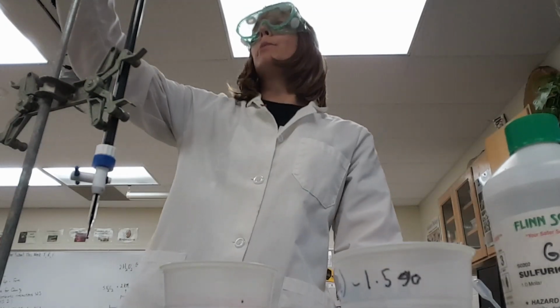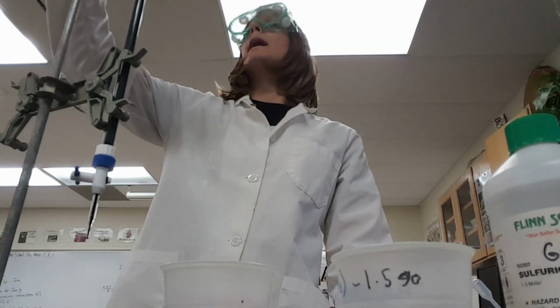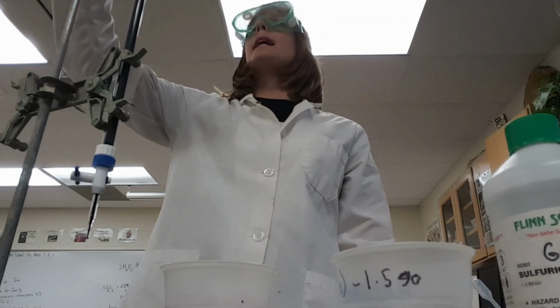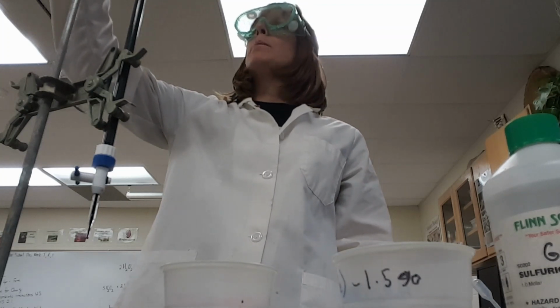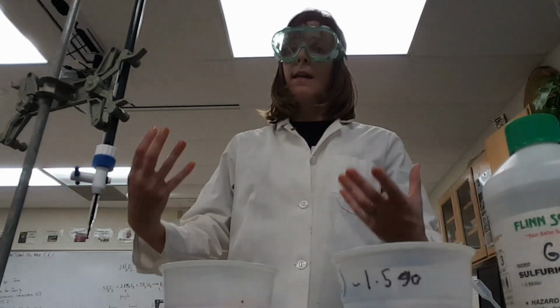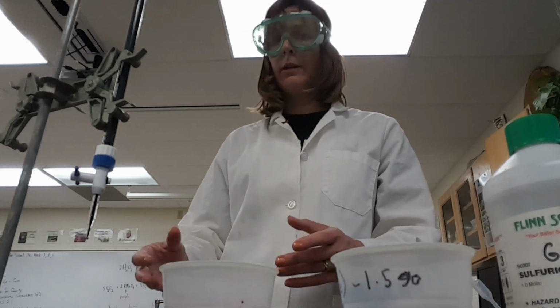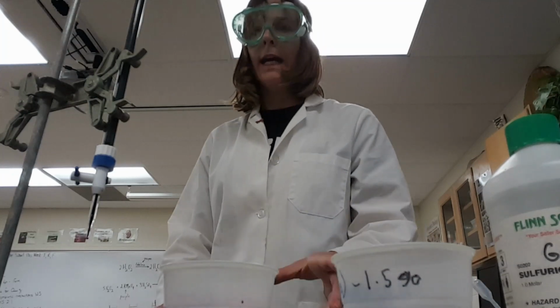So I'm going to want to measure on my burette. I was at 9.2. Now I am at, I was at, looking upside down, the readings are upside down. I was at 8.8. So, because the reading's upside down. I was at 8.8. Now I am at 11.6. Okay, so 8.8 minus 11.6, that would be the amount of hydrogen peroxide that is in the solution. Okay, so you go through and you'd add that. I don't have my calculator ready to go with that. Hang on.